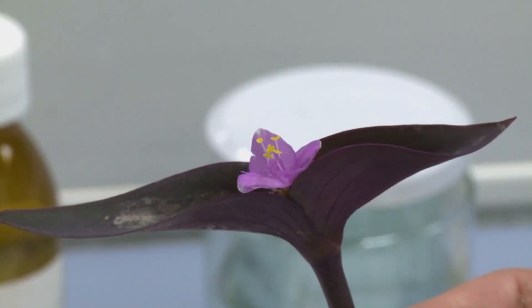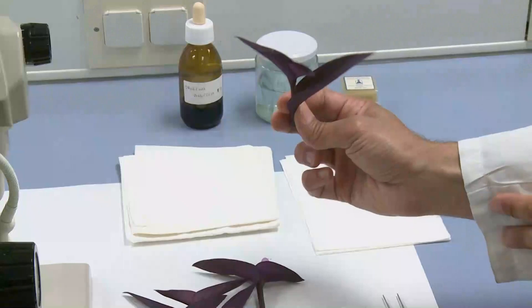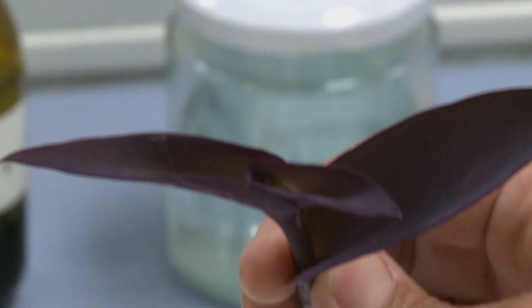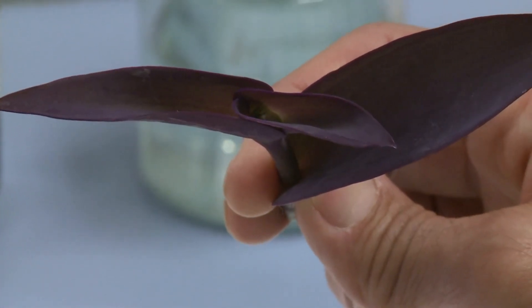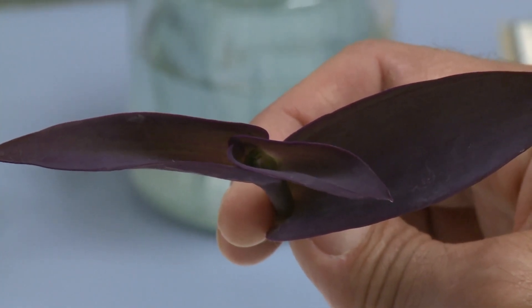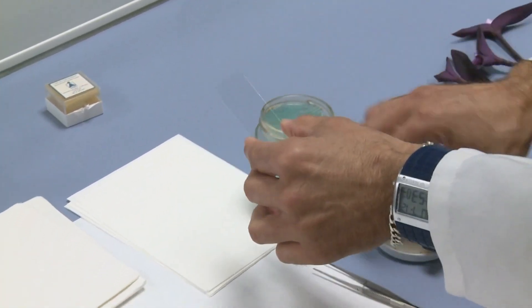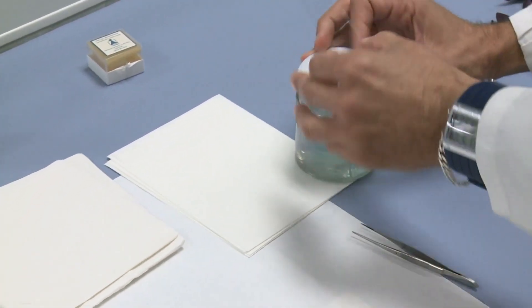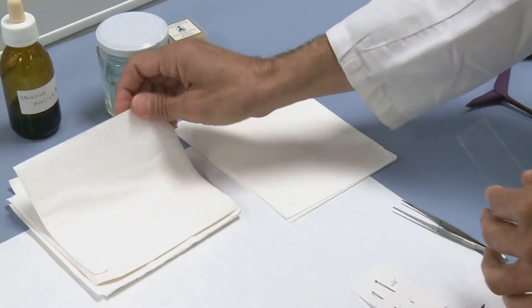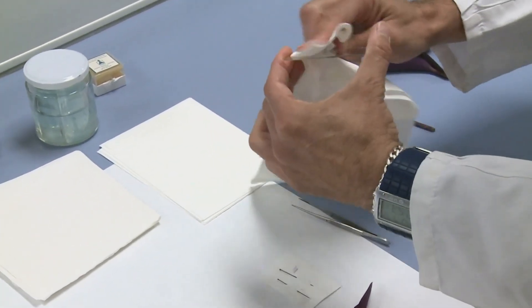The first step is to collect flowers. In this case we have flowers that are open so we can see the anthers — the anthers are yellow — but we want to collect flowers that are in a previous stage. So we have here flowers still closed inside of the inflorescence. We pick a slide and we have to clean it to observe the preparation in the best condition. So we clean the slide.